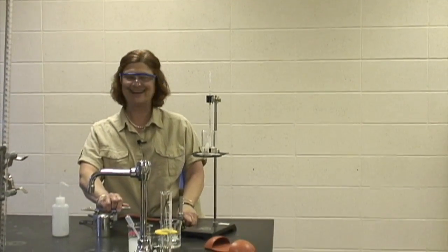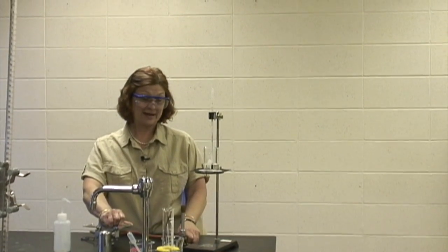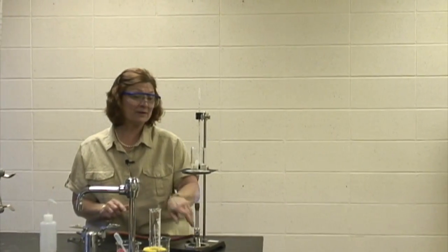And I just love that Bunsen burner. Here we go. And I will go ahead and heat this up. And I'll see you as soon as it's boiling again.